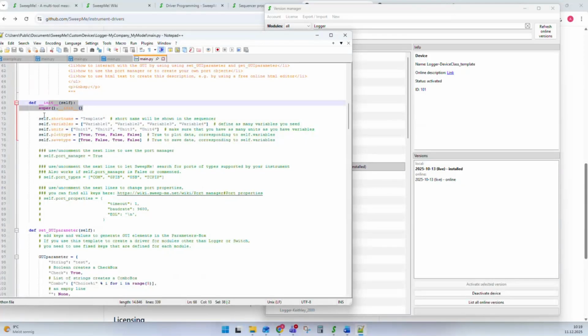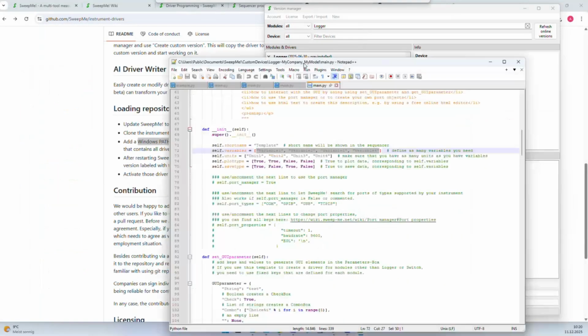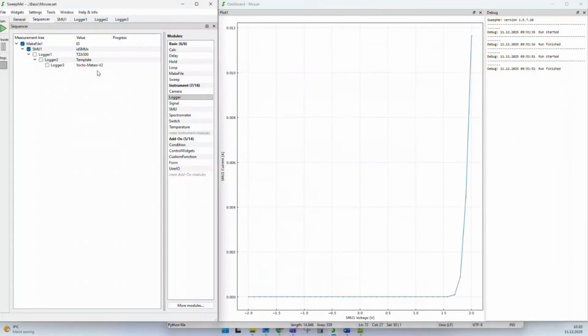An important part of these drivers is what you can say directly here at the beginning. You have different variables that you can define, and each driver has to tell SweepMe how many variables and units there are. Sorry, these two lines. For example, this driver has 4 variables, and the units are called unit 1, unit 2, unit 3, unit 4. If you don't have a unit, just keep it as an empty string. This is how you tell SweepMe how many variables will be returned by the driver. We can also define whether this variable can be plotted or whether it should be saved to the file. Further, there's also a short name, which is here called template. This is what you see here in the value of the sequencer. This is a short name that quickly helps you to identify which driver or which instrument was selected.